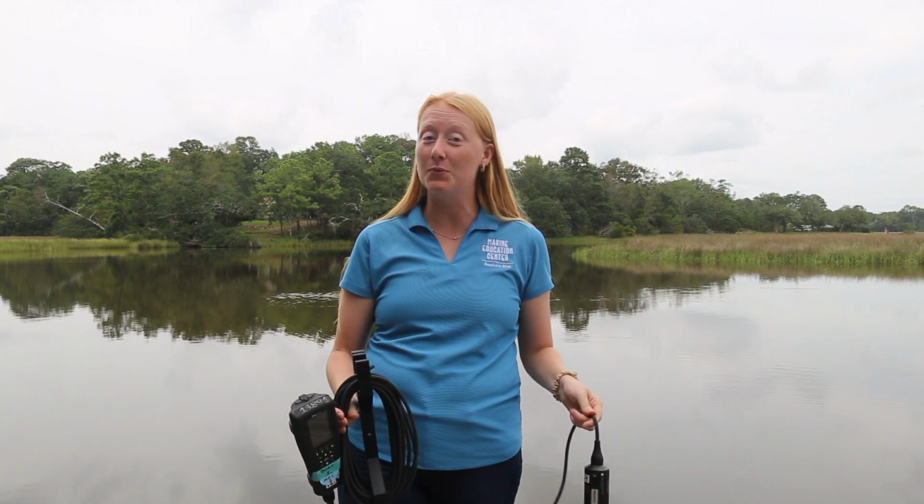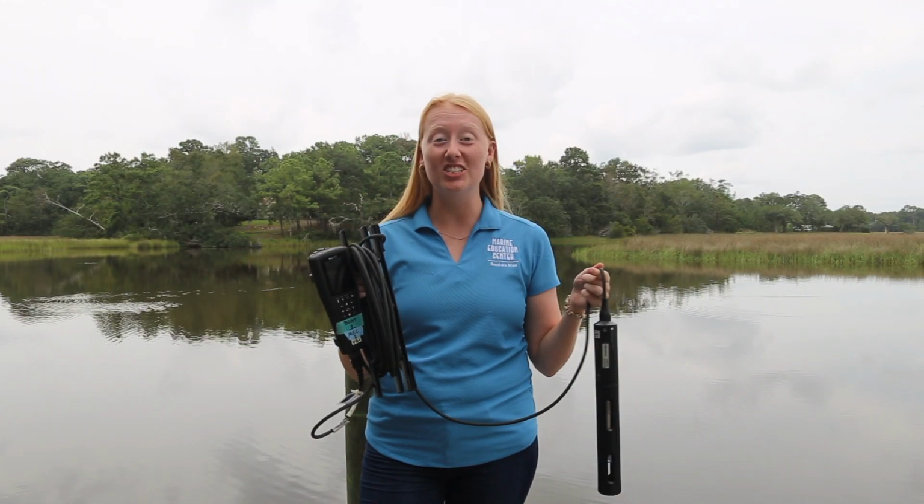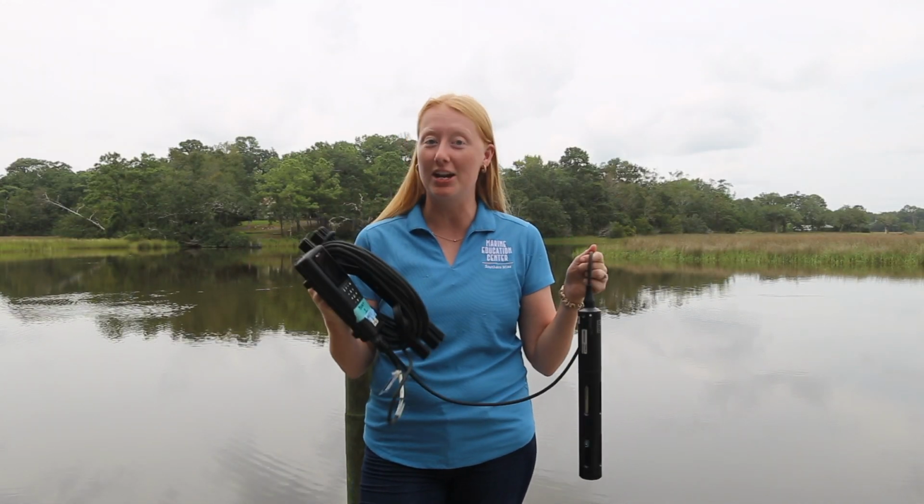There are a couple of ways you can actually test water quality, but the device we're going to be using today is called a YSI. YSI actually just stands for the company that makes it, not what it actually does.